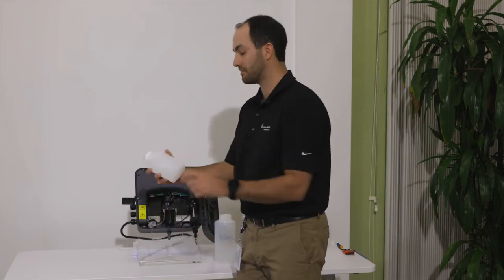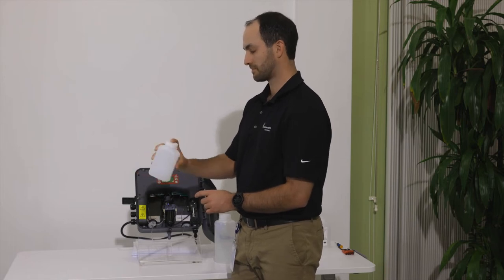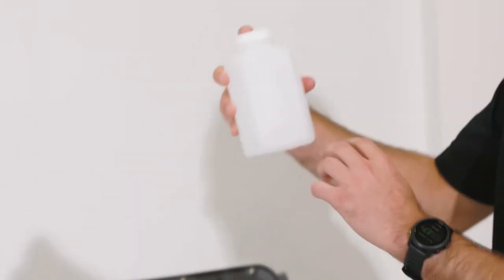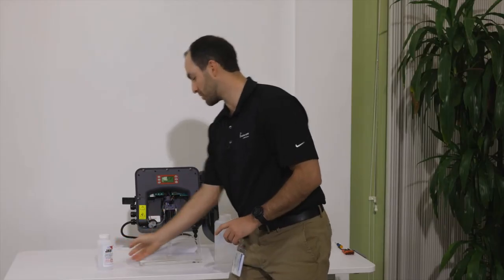We'll put the cap back on. We will invert this and you may see a little bit of powder still at the bottom. That's okay. Let it sit while you mix the rest of your reagents.